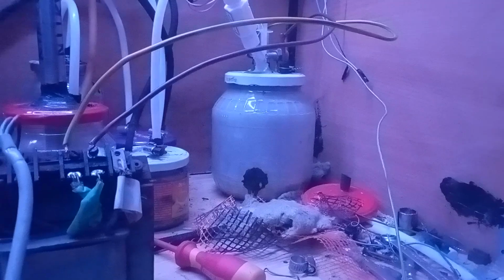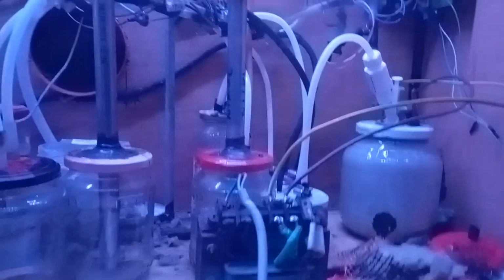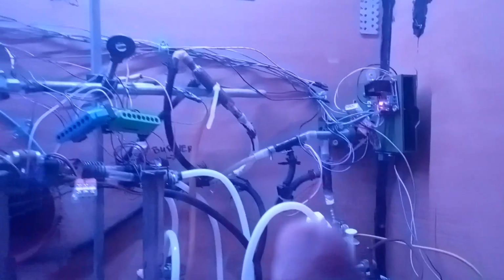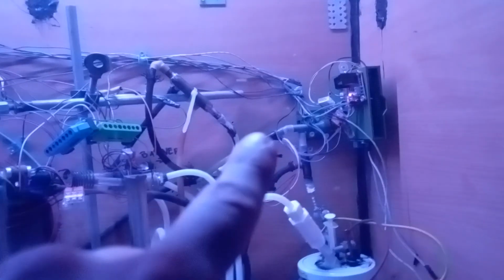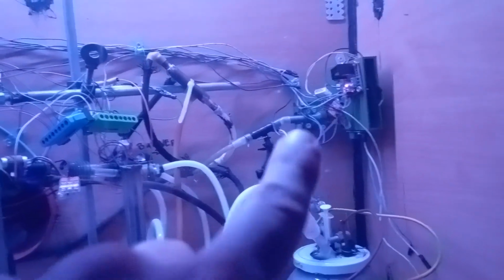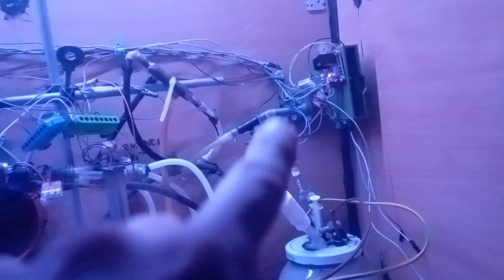I have built everything, and now the system is working, and unfortunately the burner is not producing SO2 in the way I want it to. As you can see, the line goes there. This is just the heat exchanger's boost tube. Maybe I'm going to take it down, but the line goes up there. It goes into the flow system's needle valve, then into the burner, then to the dryer, and so on.